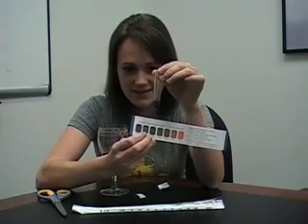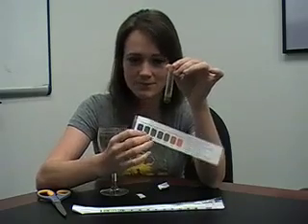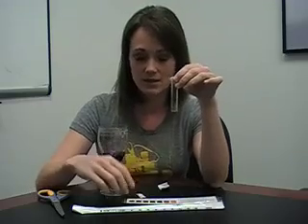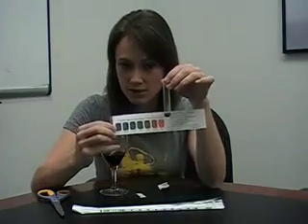It's starting to go dark green and now it's starting to get like this brownish hue. With red wines you have to be careful with this test because the pigments in the red wines do affect the outcome. With white wines you don't have to worry about it and you want to look for a 0.2% reading. With red wines, because of the pigments, we watch the color as it boils to make sure it goes through this dark blue 0% color.